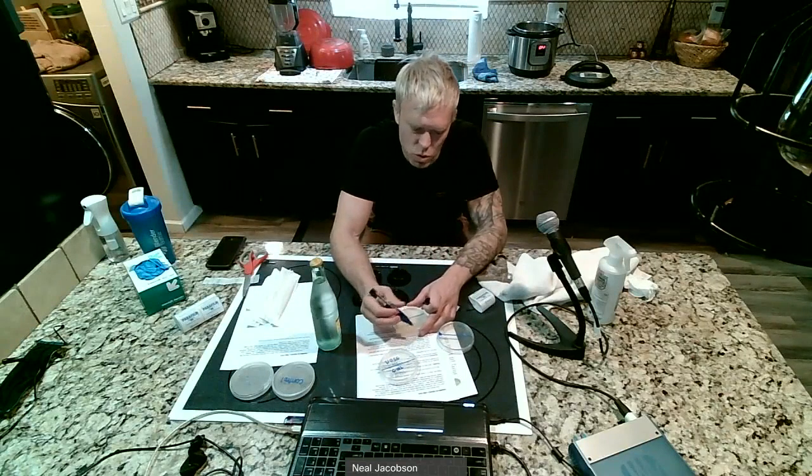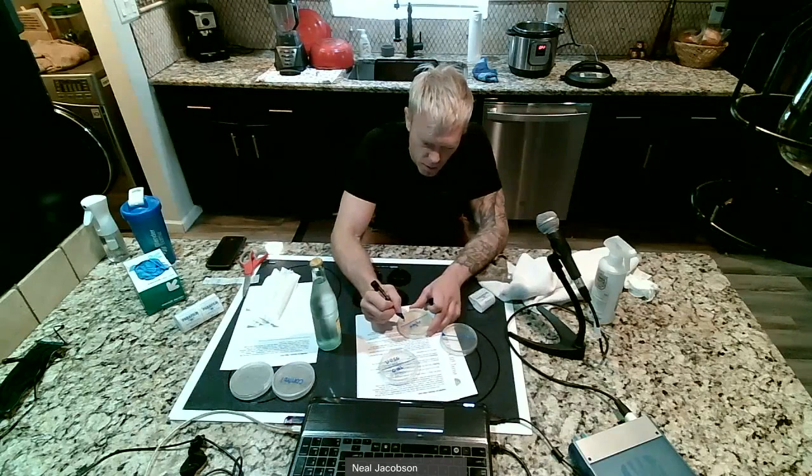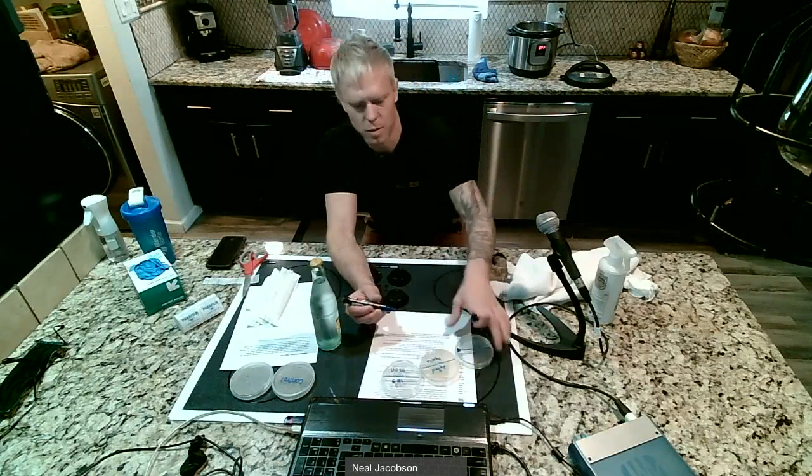Let's do belly button and armpit. So that'll be my next one.